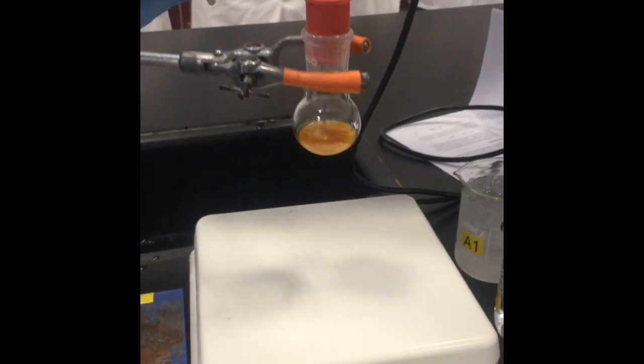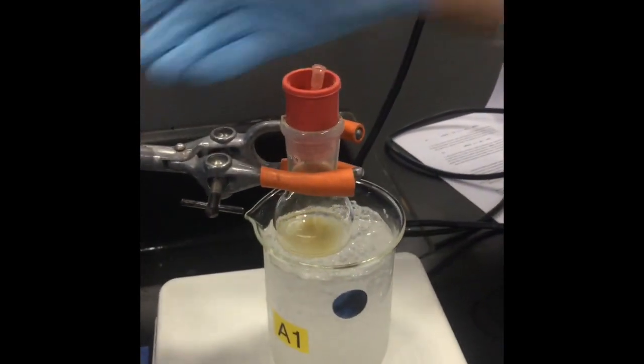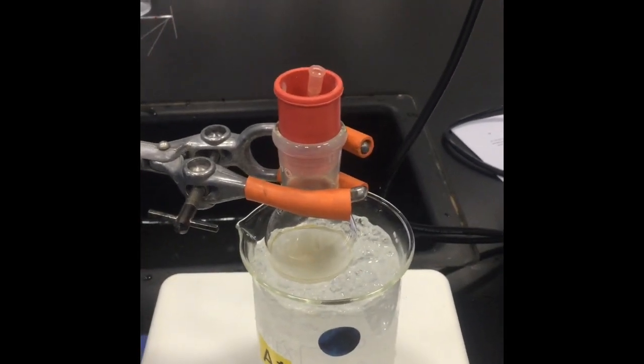You will also notice a small amount of precipitate. Once the precipitate starts forming quickly, the solution will go clear. Place the solution on an ice bath and continue stirring.